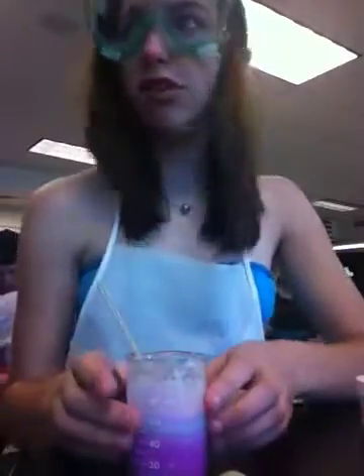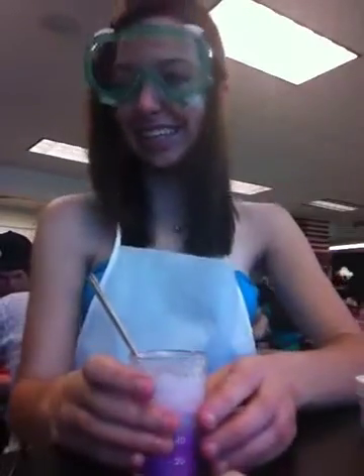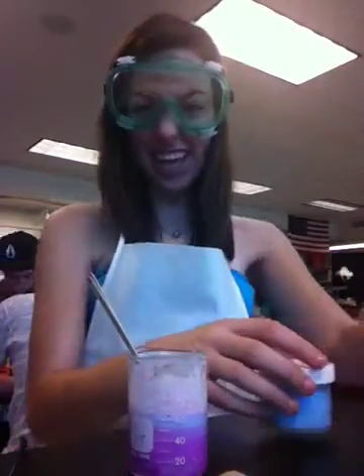Kirsten Brooke, how are you guys doing in the lab? Any questions? Good! Good. Yeah, we're just waiting for it to drip out. She's coming over here. She's coming over here.